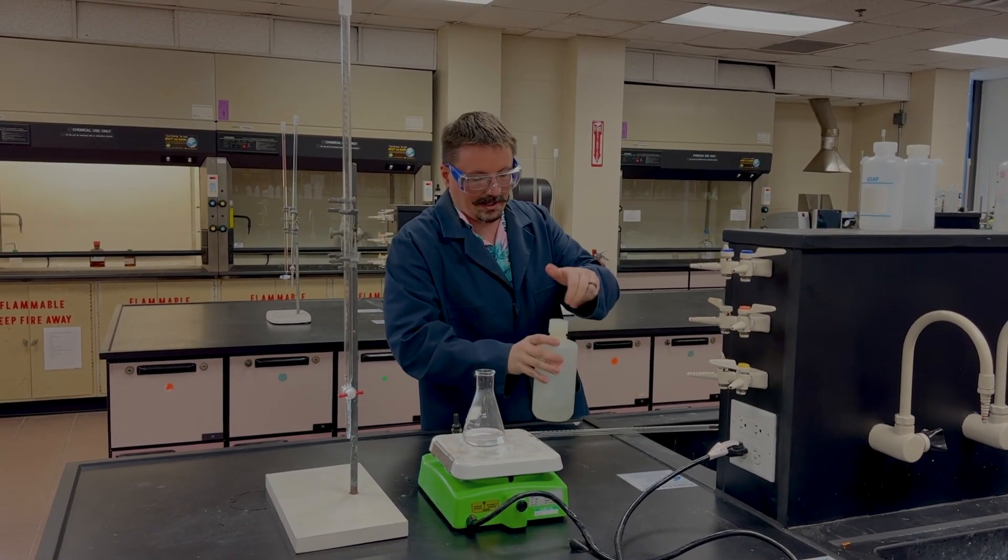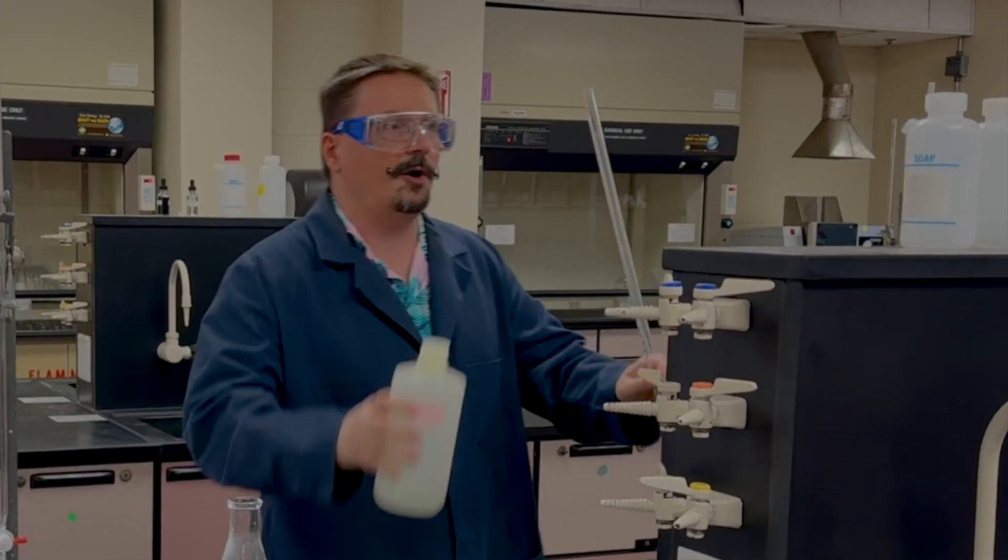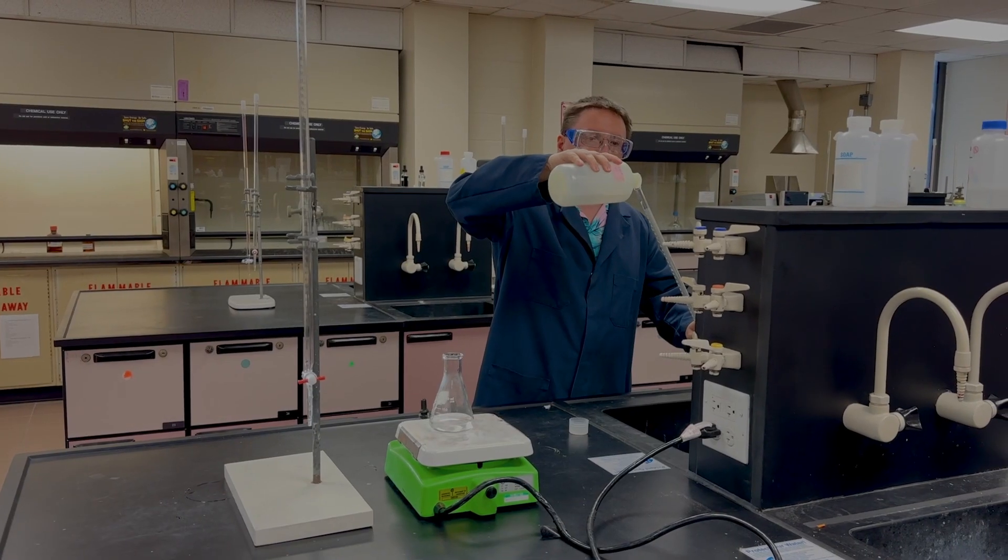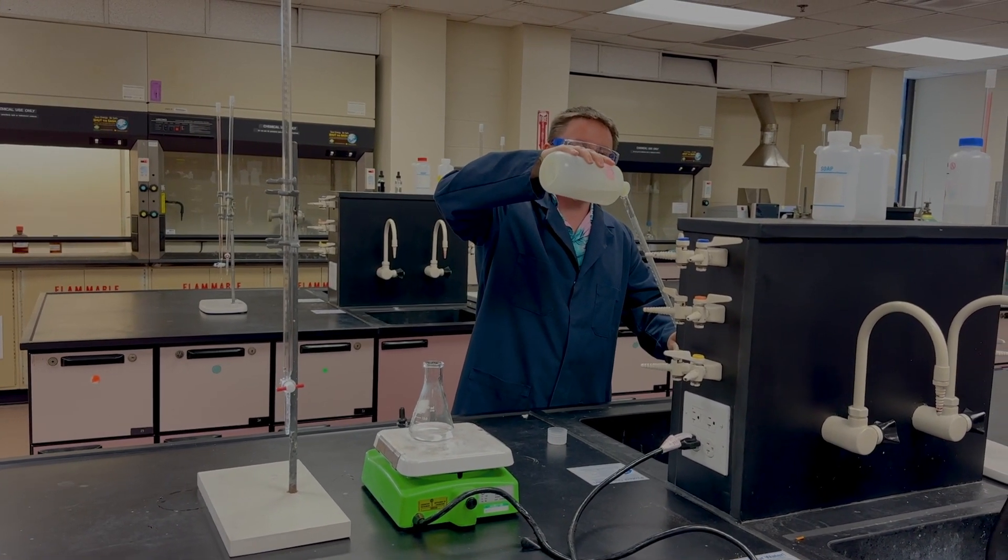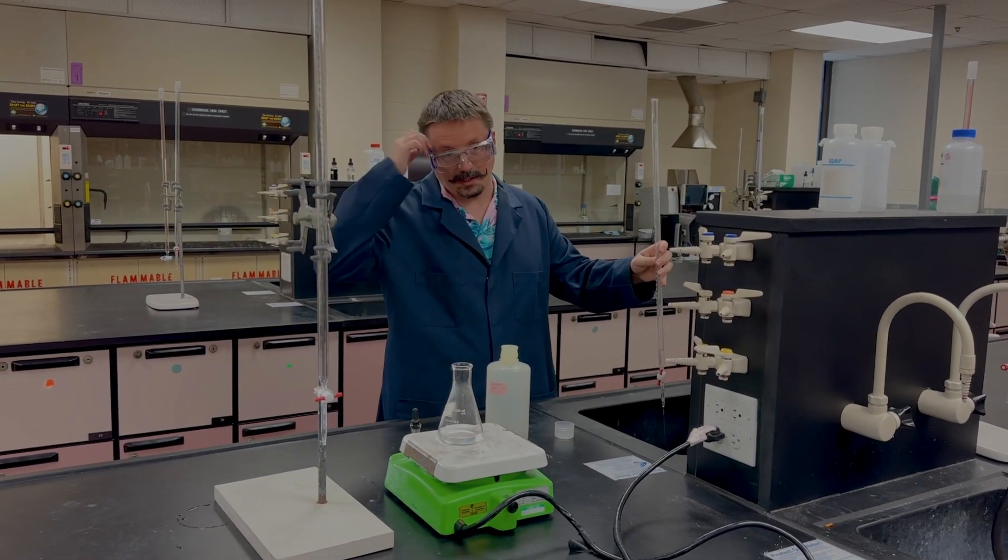We're going to get our HCl out, and I'll maybe do a small aliquot, do a little rinse of this burette before I actually fill it and use it.